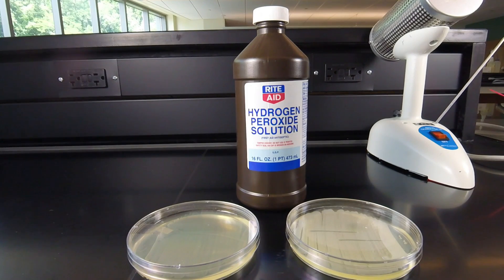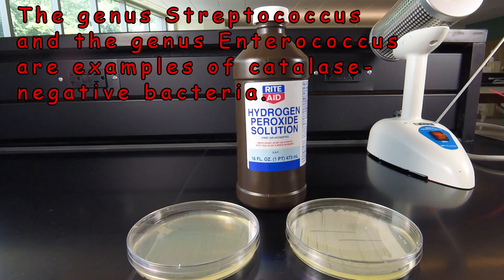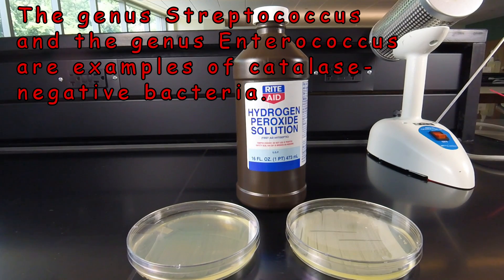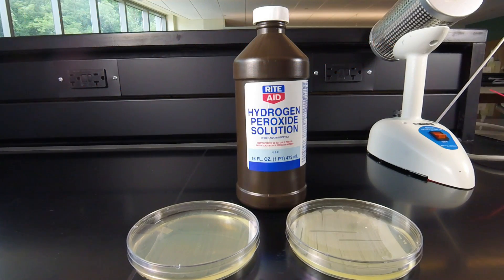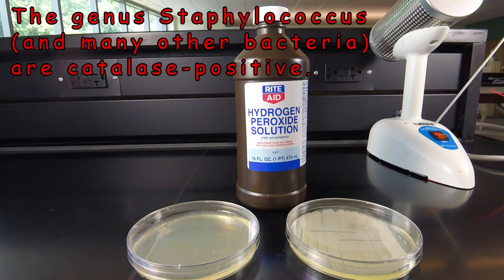We're going to be using this test later this semester to help determine the genus Streptococcus and the genus Enterococcus. These two bacteria strictly get their energy from fermentation — they don't have an electron transport chain that uses oxygen as an electron acceptor, so they have no need for catalase. Most bacteria that carry out aerobic respiration, such as Staphylococcus, have the enzyme catalase because they do generate hydrogen peroxide.